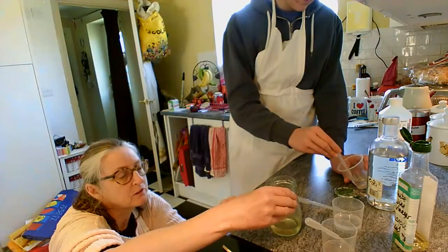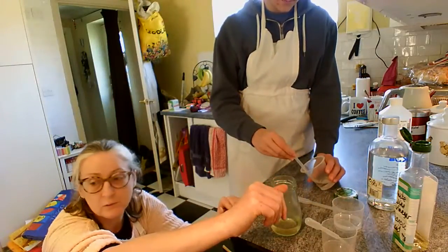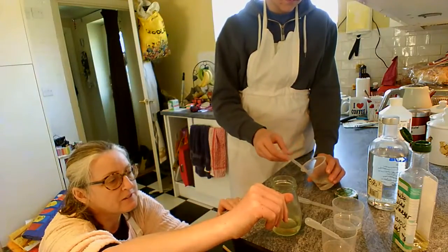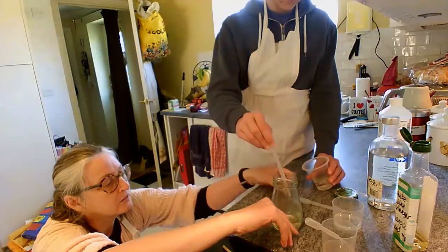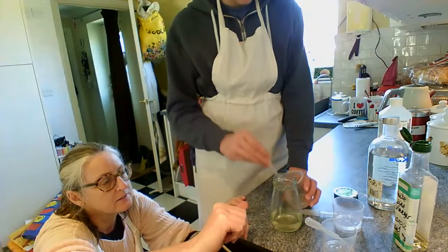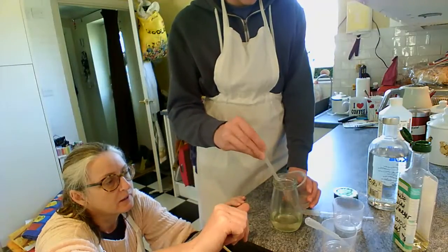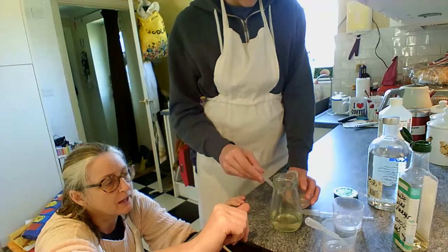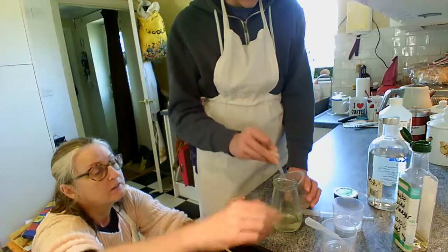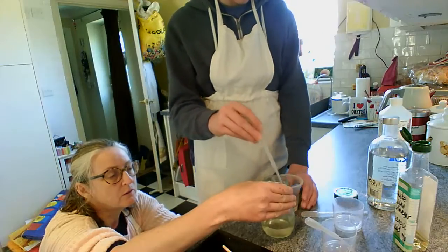Of course, as with all chemistry reactions, you probably have to sit here and wait for it to take place. The only problem with doing this experiment at home, guys, is the lack of strong acid. Can we get the 2 cups closer to each other so we're less likely to get spillage on the counter? Thanks. It's the lack of strong acid that is your big problem, and looking for places where you can get strong acid from, you're probably going to have to go down the drain cleaner route, which is a very strong acid. Okay, you can stop there.